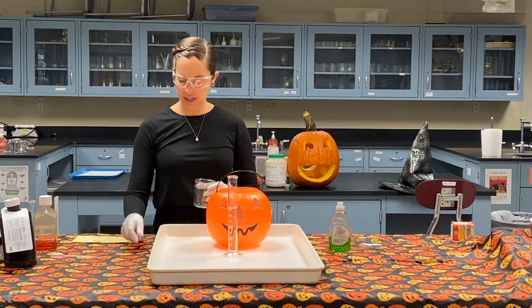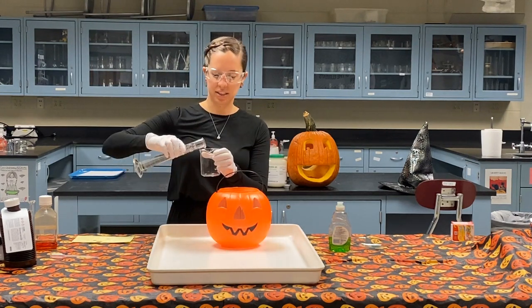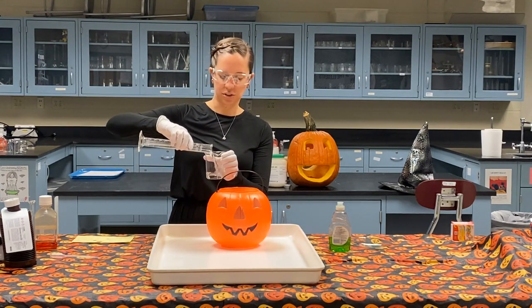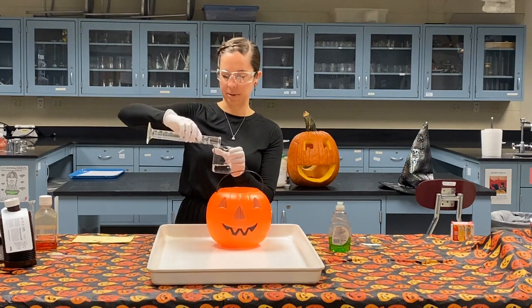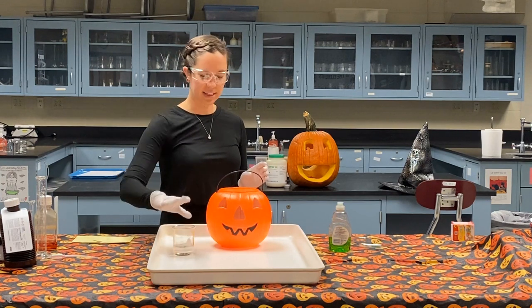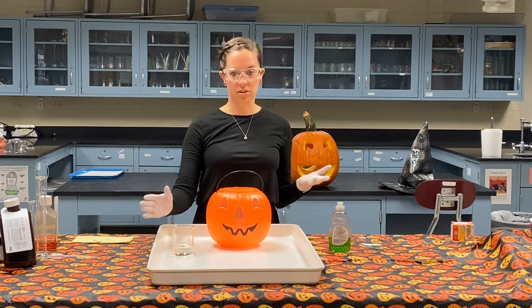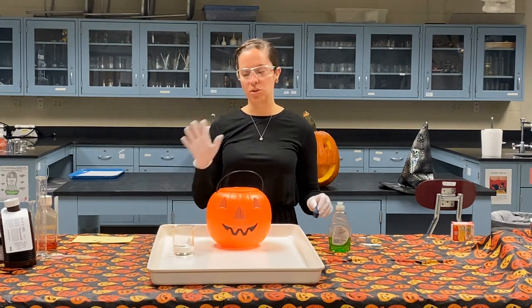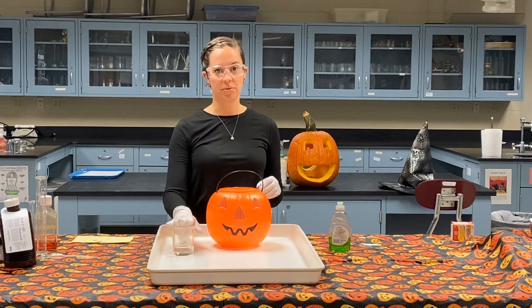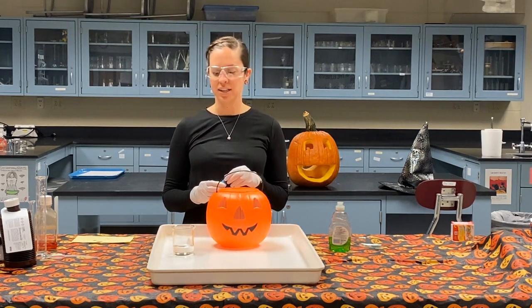So hydrogen peroxide is a colorless solution on its own. You're seeing it right here. I am wearing gloves because this is very caustic when it's this concentrated. Burns your skin a little bit. It's not very pleasant. All right, so I'm gonna take our hydrogen peroxide. Now, if I let this sit here, it is light sensitive, that's why it's in that dark bottle. If I let this sit here, eventually it would decompose into water and oxygen gas, but it would take a really long time. So we're gonna catalyze it and add some secret ingredients here to make it a little bit more entertaining.